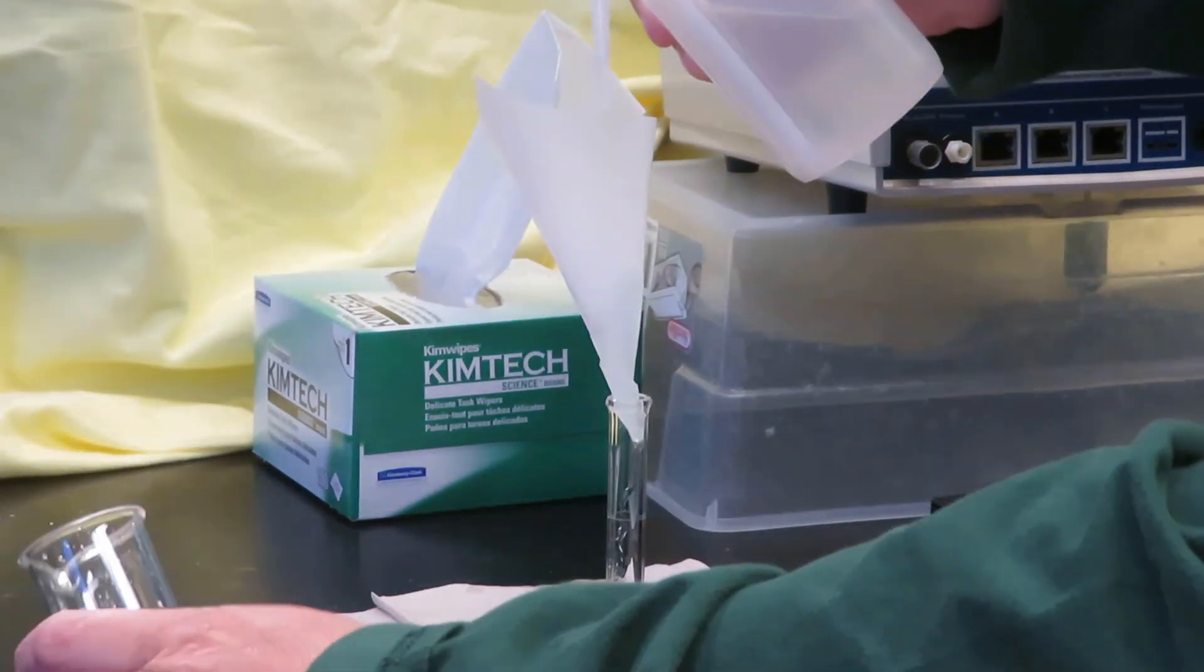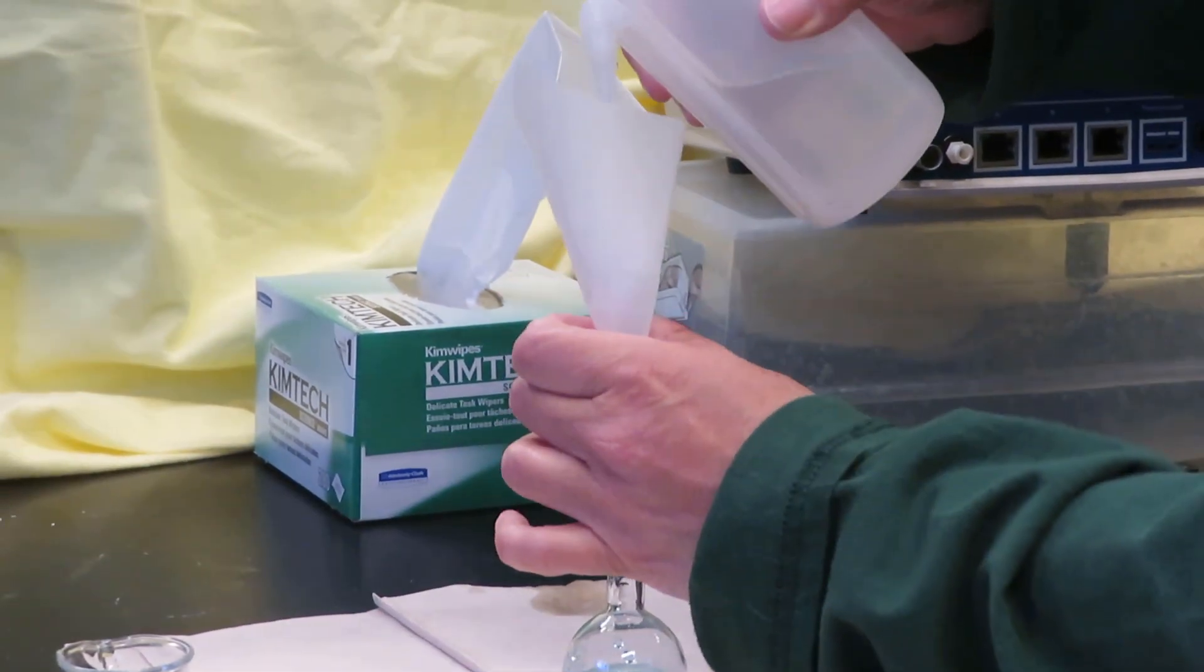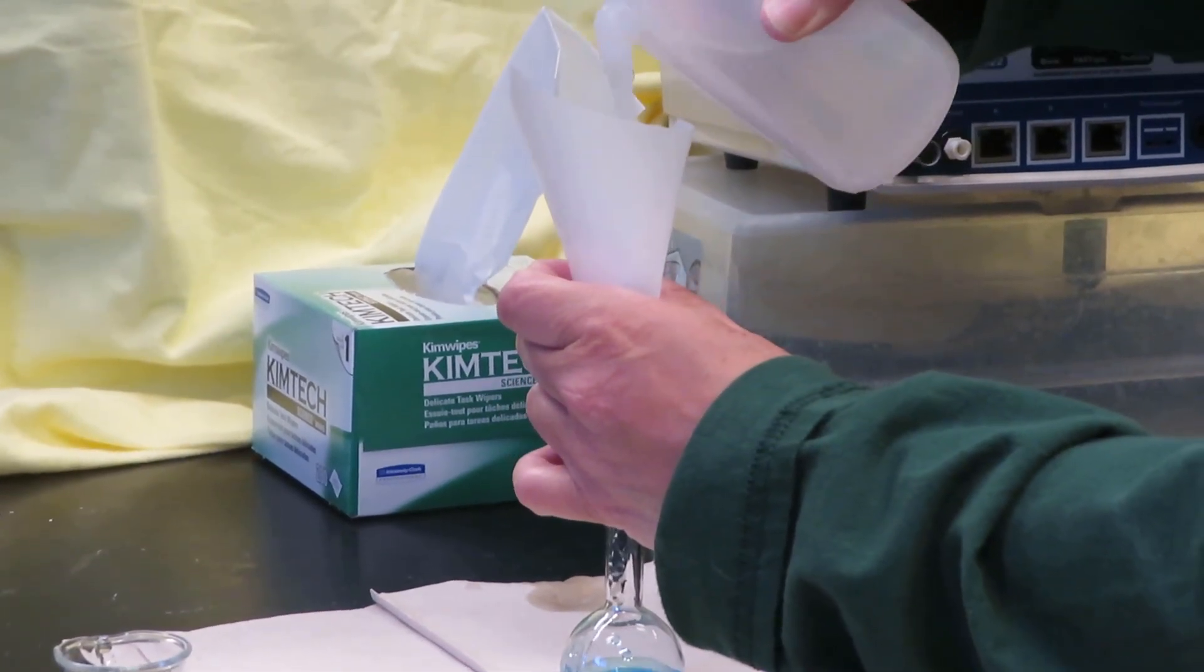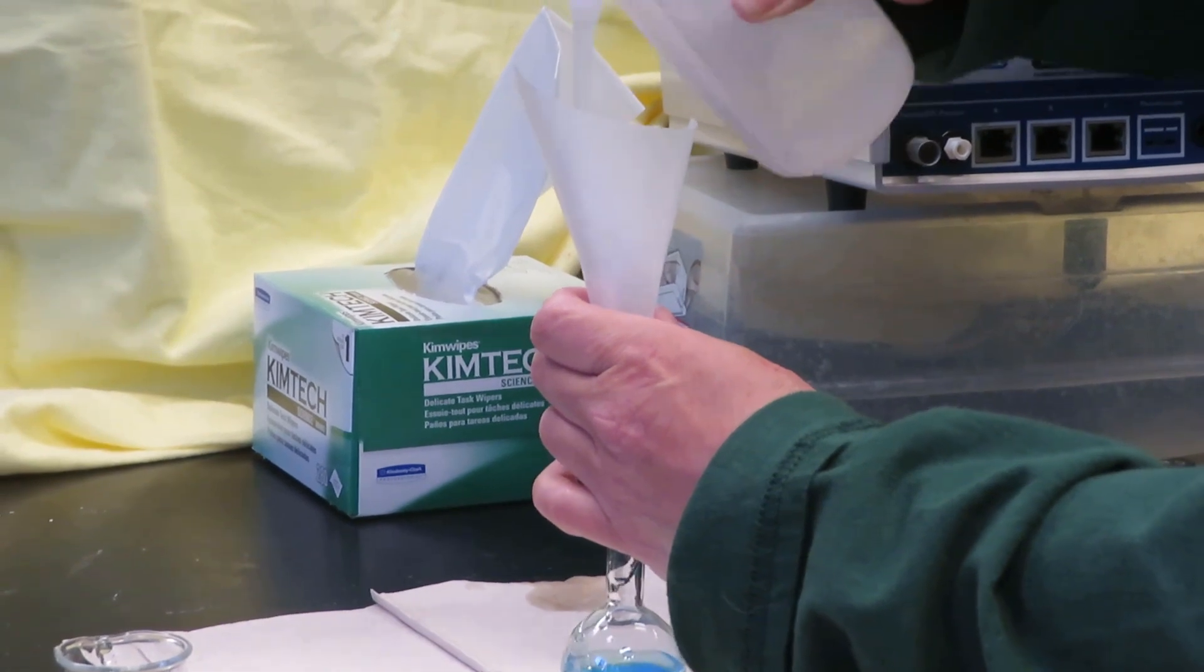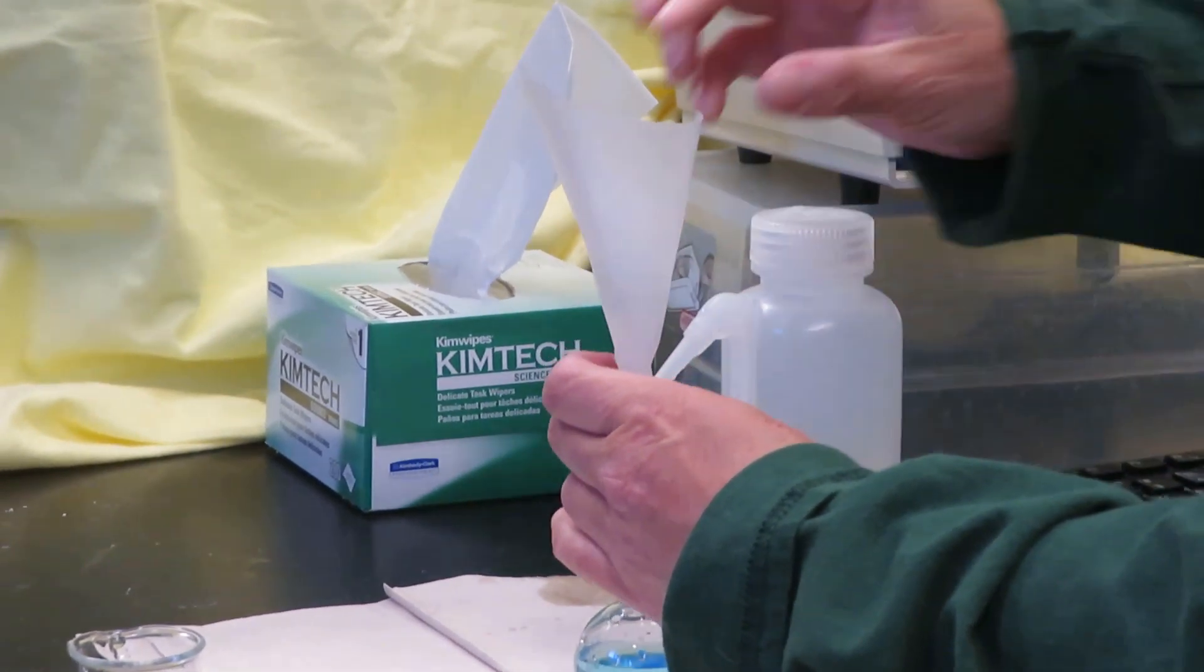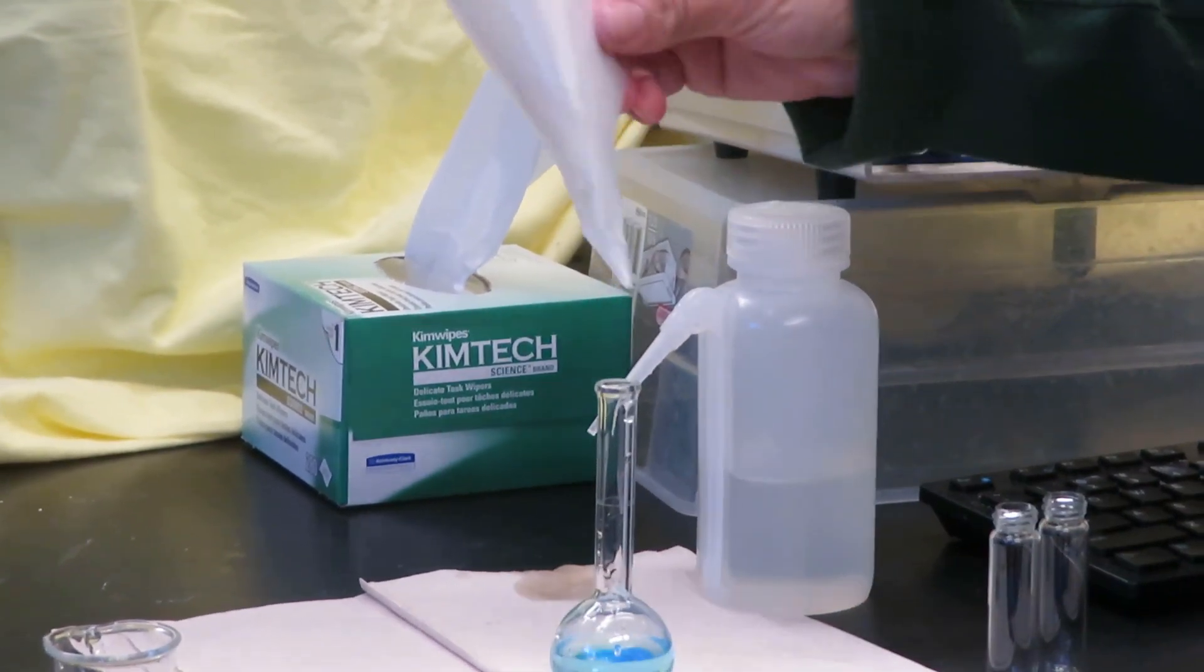I want to make sure that everything in my little paper funnel goes into the volumetric flask as well. So I'm going to rinse that. And that looks good.